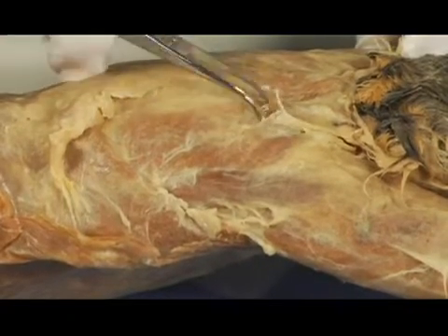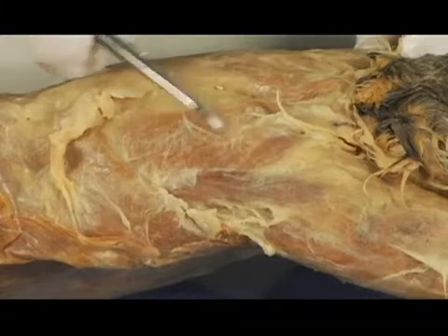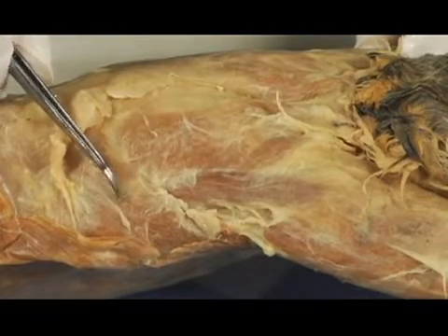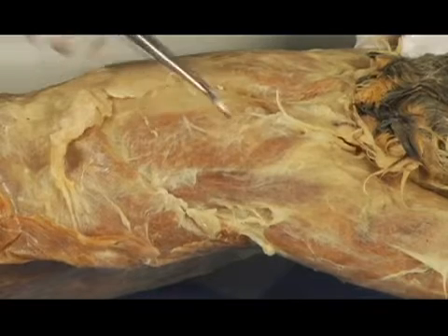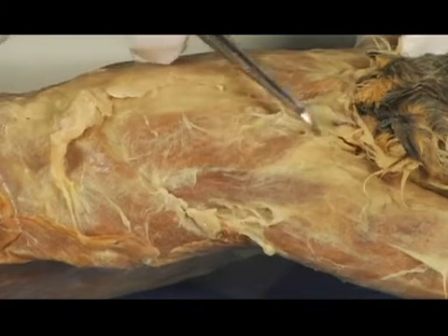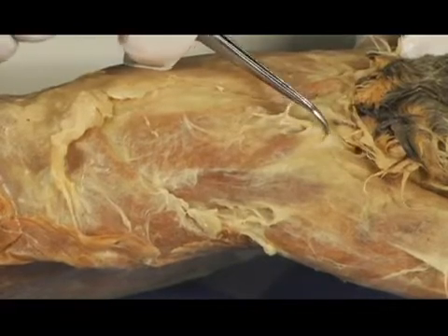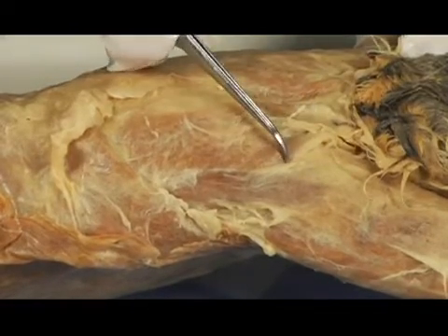Move a little bit more tissue. This broad kind of flat area right there. Okay, so we have one muscle here. We have another one here. Then you can see something that's running up sort of towards the neck at an angle. There's another muscle there. I'm going to define that just a little bit more.